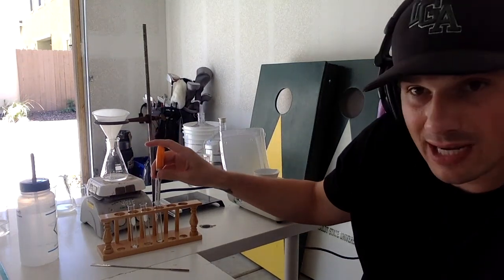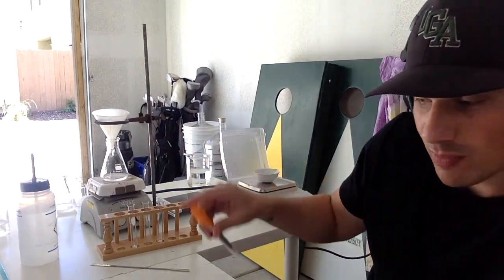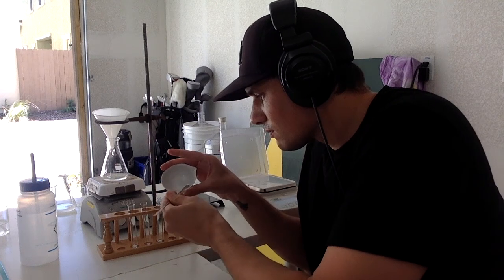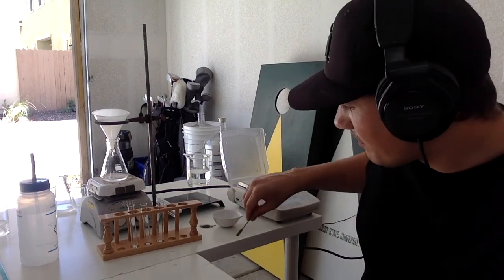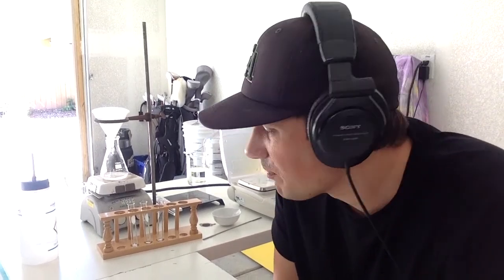This powder right here is a Bayer aspirin tablet. Okay, so it is acetylsalicylic acid. It's aspirin. What we're going to put in this test tube right here is what we made. So let's get a little sample of this bad boy. Looks like a good combination of both of them. To be honest, it looks like crystals, coloring like aspirin or salicylic acid. So I don't know if we got really good results, but it's the best we could do.